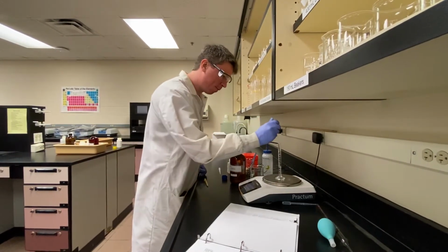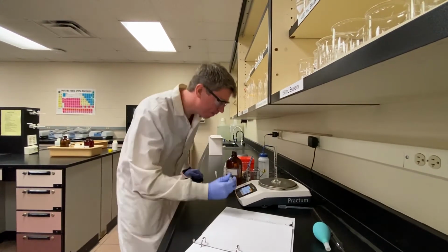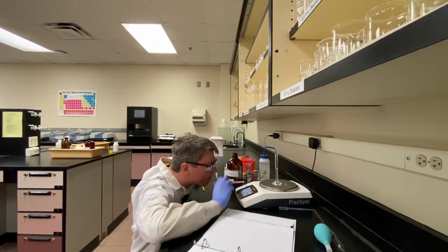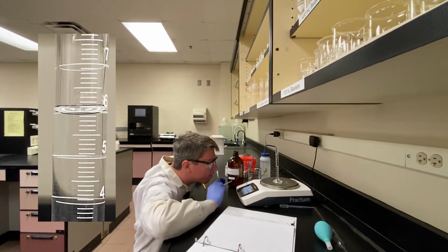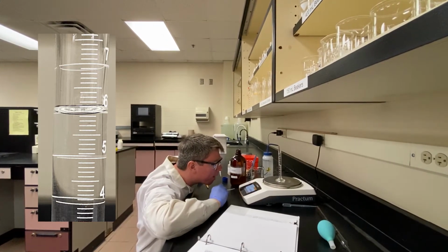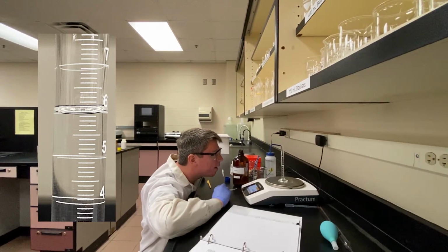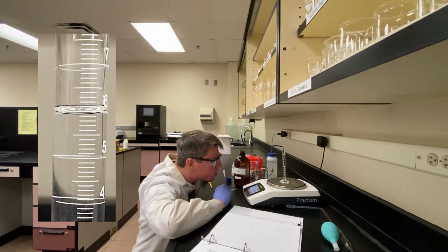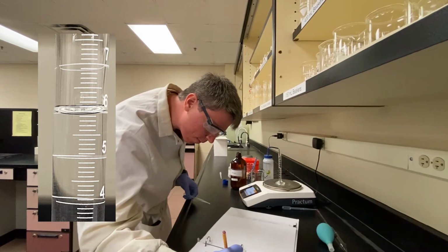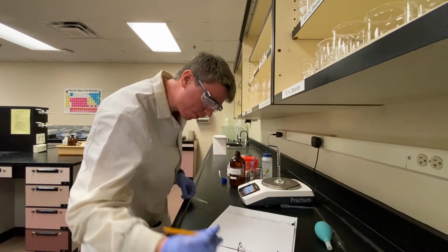Now that I've done the 4 milliliter amount, let's go ahead and bring it up to about 6. There we go. Let's see. It's a little below 6, so 5.92. And 4.65 grams.